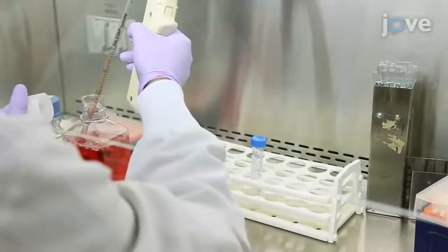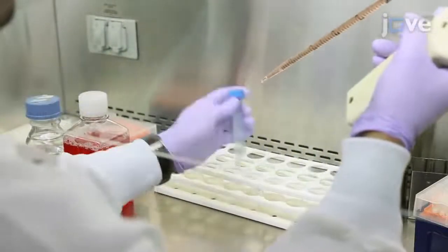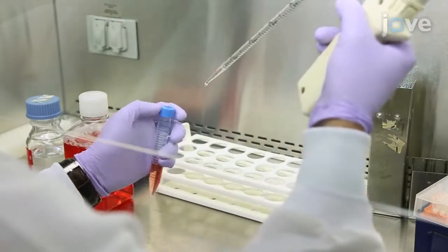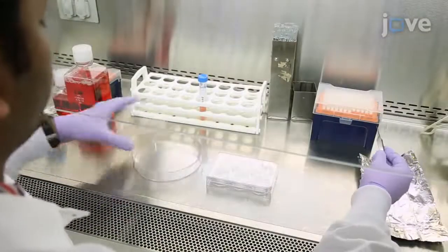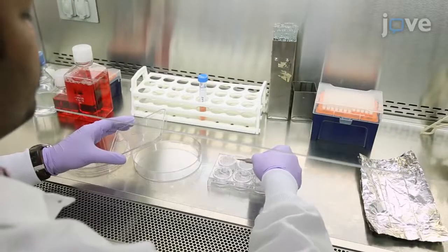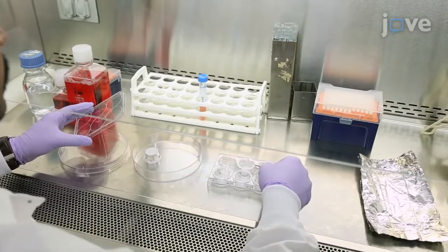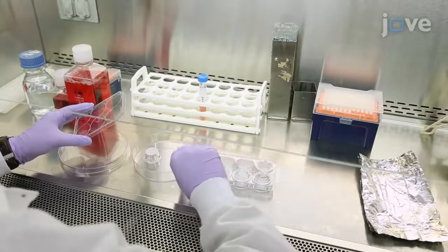After counting, dilute the cells to a concentration of 100,000 ovarian cancer cells per mL of complete growth medium, and place three inverted 0.4 micrometer pore tissue culture treated polycarbonate membrane cell culture inserts per experimental condition in an appropriately sized sterile tissue culture dish.